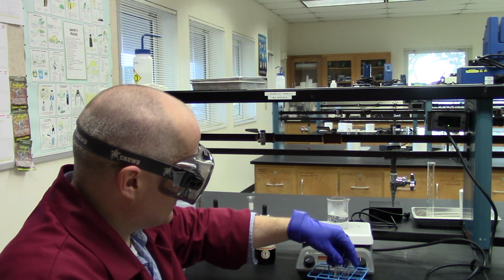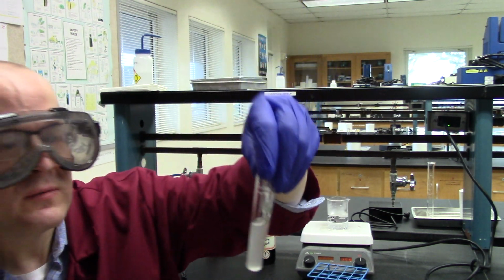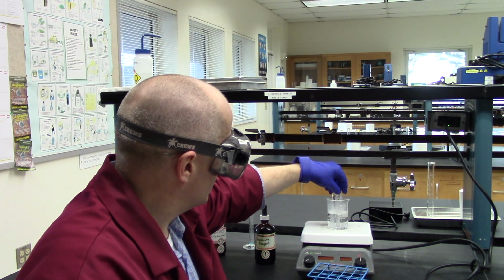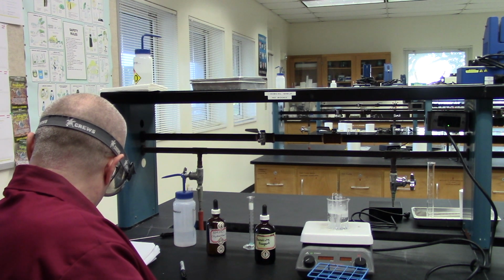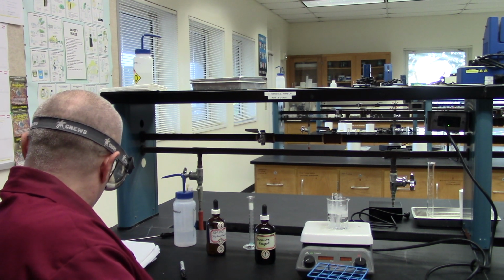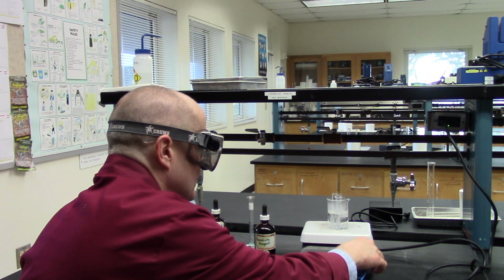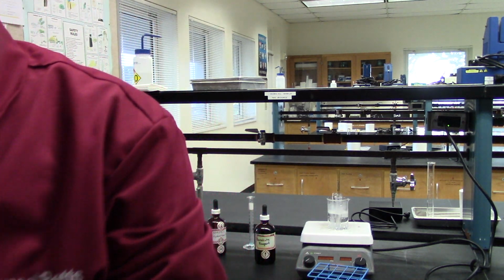And now I'm going to put them into the, as you can see, they haven't changed much. They really didn't change at all. I'm going to put them into the hot water. And I'm going to let them sit there for about 5 to 10 minutes. 10 minutes, it says. So there you go. Let's let them sit there for about 10 minutes. Let's crank that up a little more, get the water to boil. All right, guys. See you in 10.